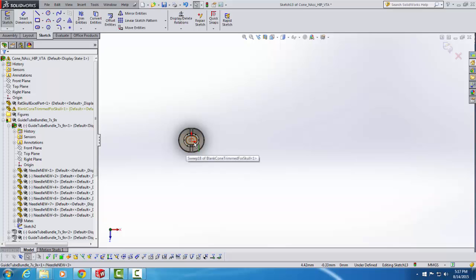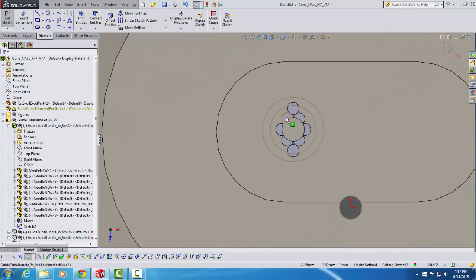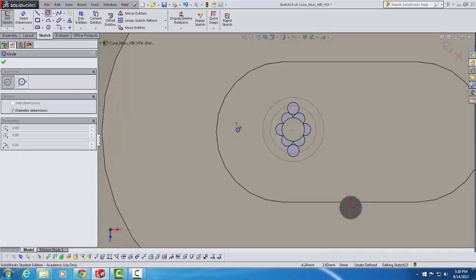So I click on the very top of the guide tube bundle, and now I get a new view that is perpendicular to that plane I selected. You can click on any one of these guide tube bundle tops when you're asked to select the plane, and you'll get the correct plane. And now I'll zoom back in, and I can see the top of the guide tube bundle, and I need to draw a circle. So I'm going to click on this circle tool up here, and then I'm going to go to the center of the bundle.